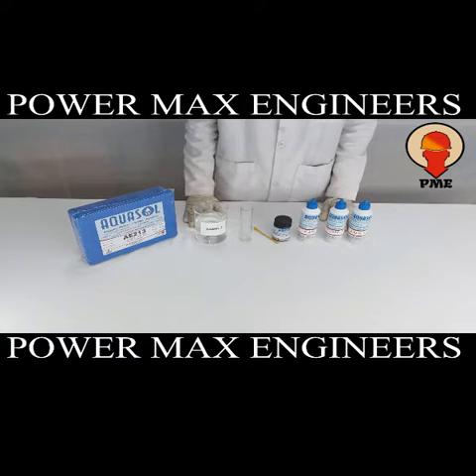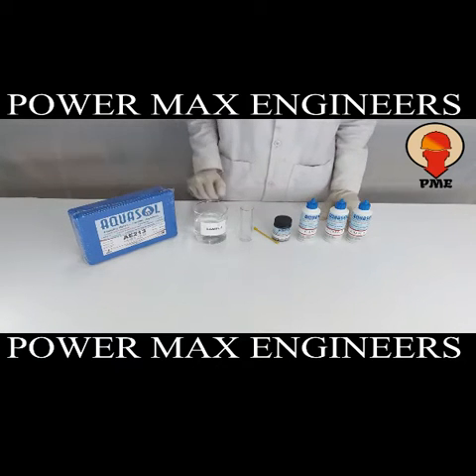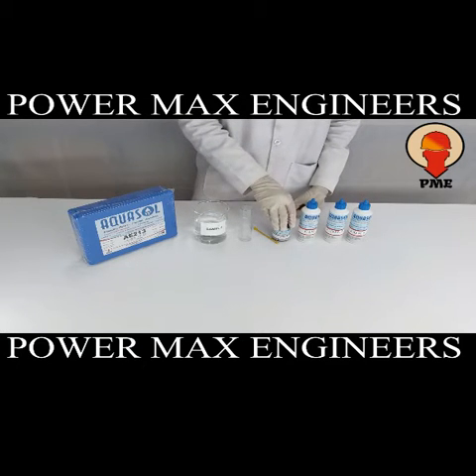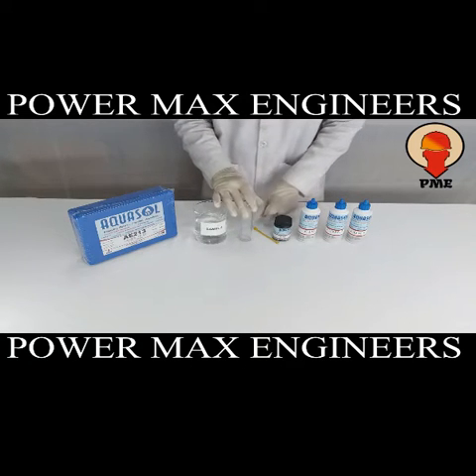We are demonstrating the chloride test kit. The Aquasol AE213 test kit is used to check the chloride of a water sample. The kit contains reagents CD1, CD2, CD3L2, CD3L5, a test jar, and a spoon.